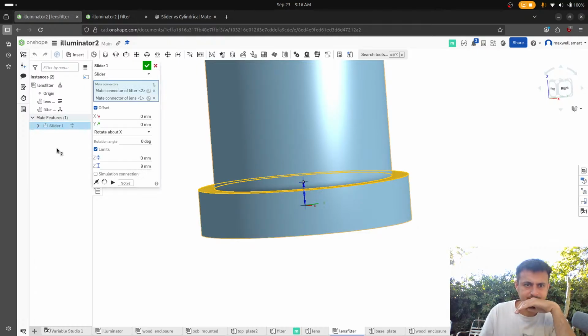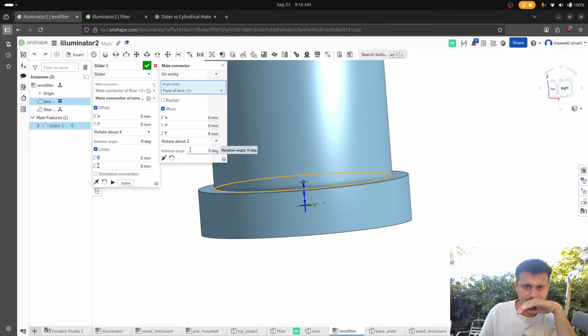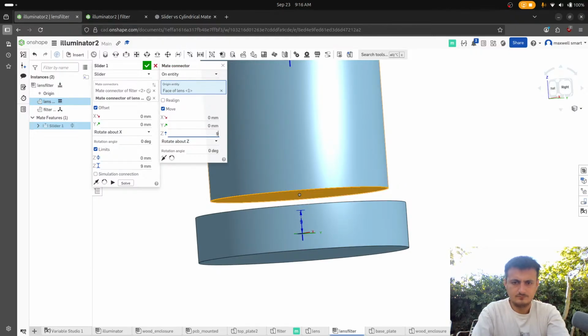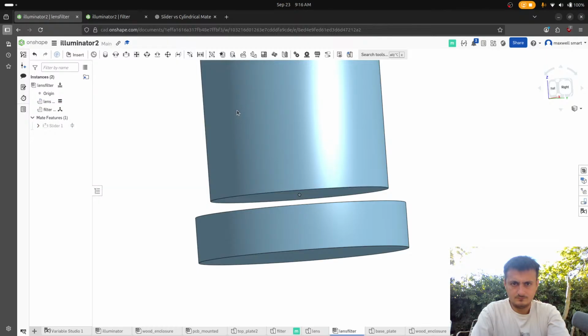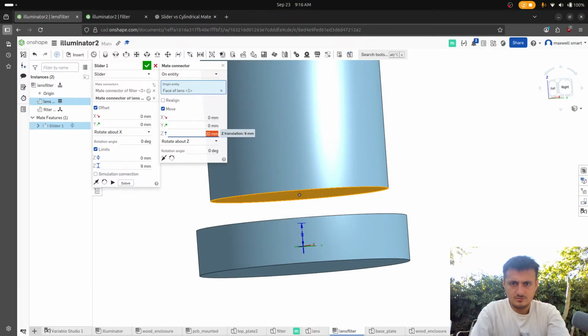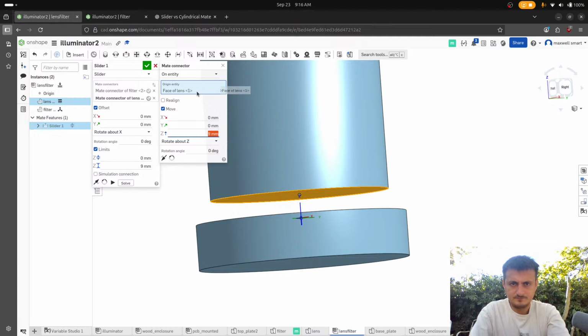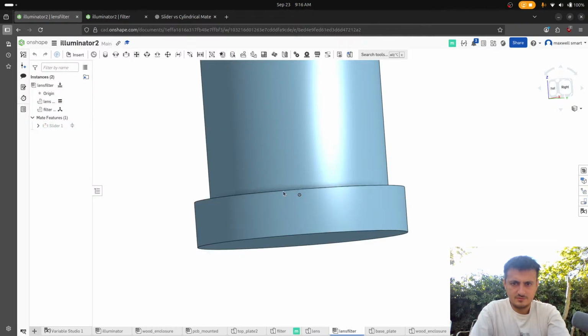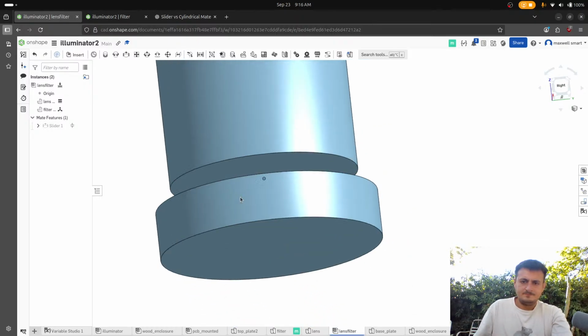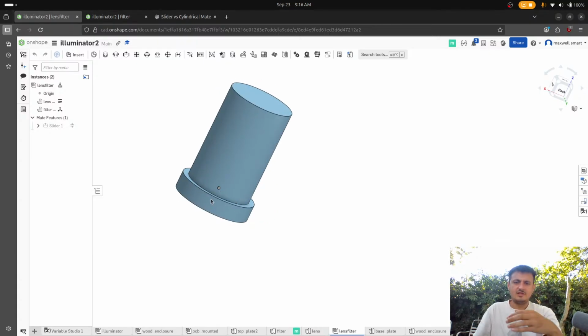It's not moving. I feel like this didn't even move. What? I don't understand. Okay, maybe it did move. Okay, there we go. So that's going to be the lens.